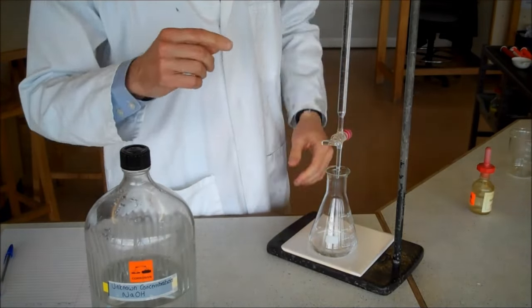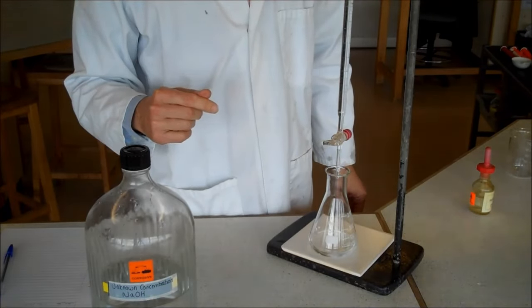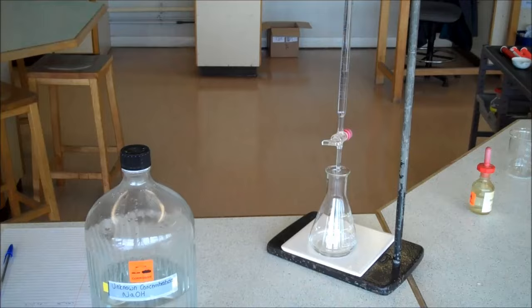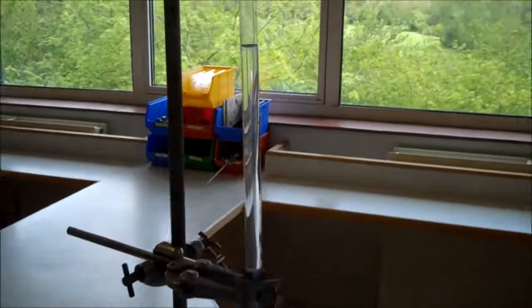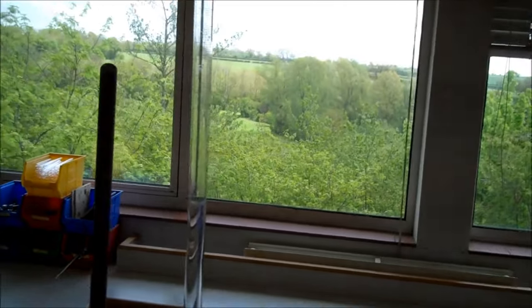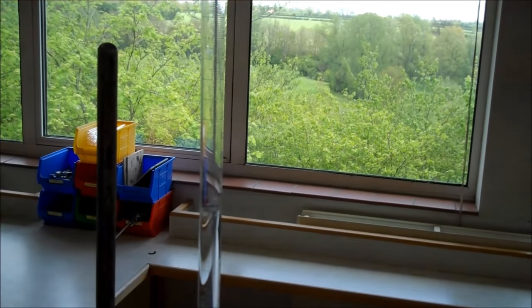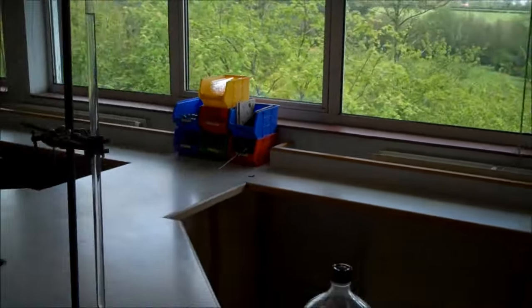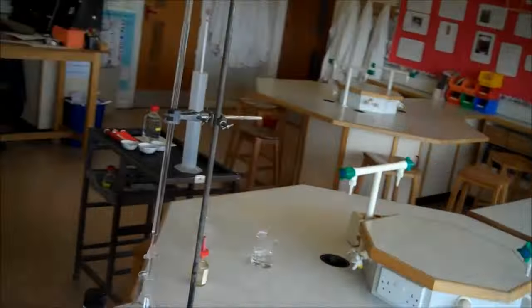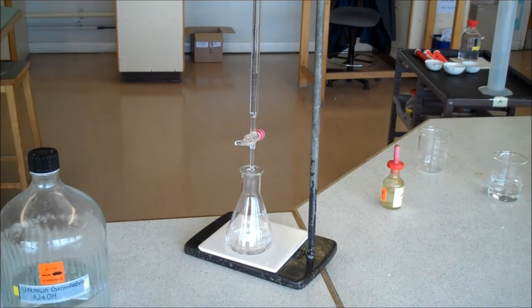Now at this stage, I read on the burette the volume of acid I have added. It may not be possible to see that, but I've added 11.8 centimeters cubed. And I'm just going to pause the video there.